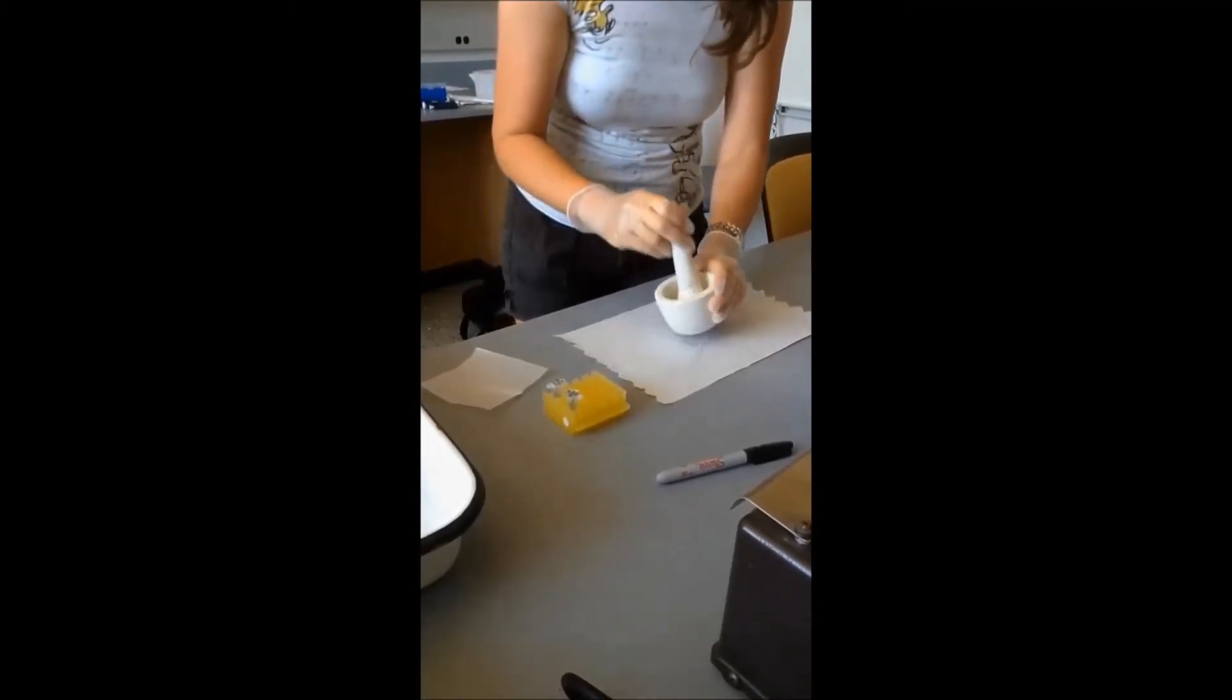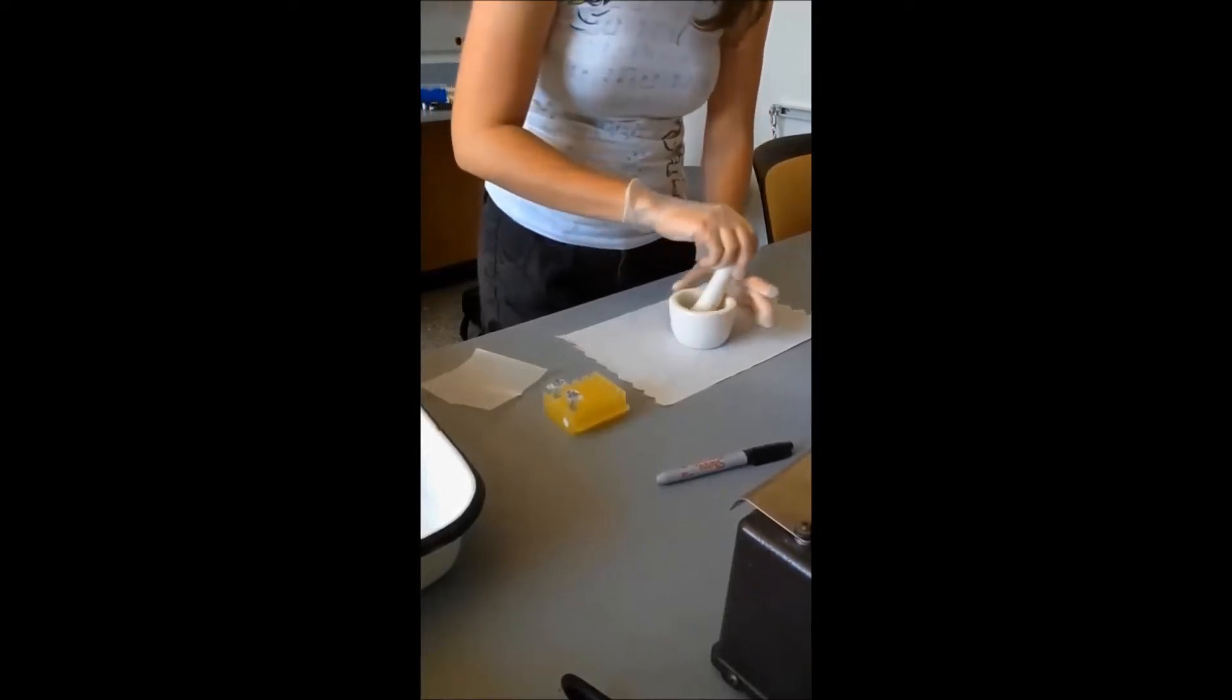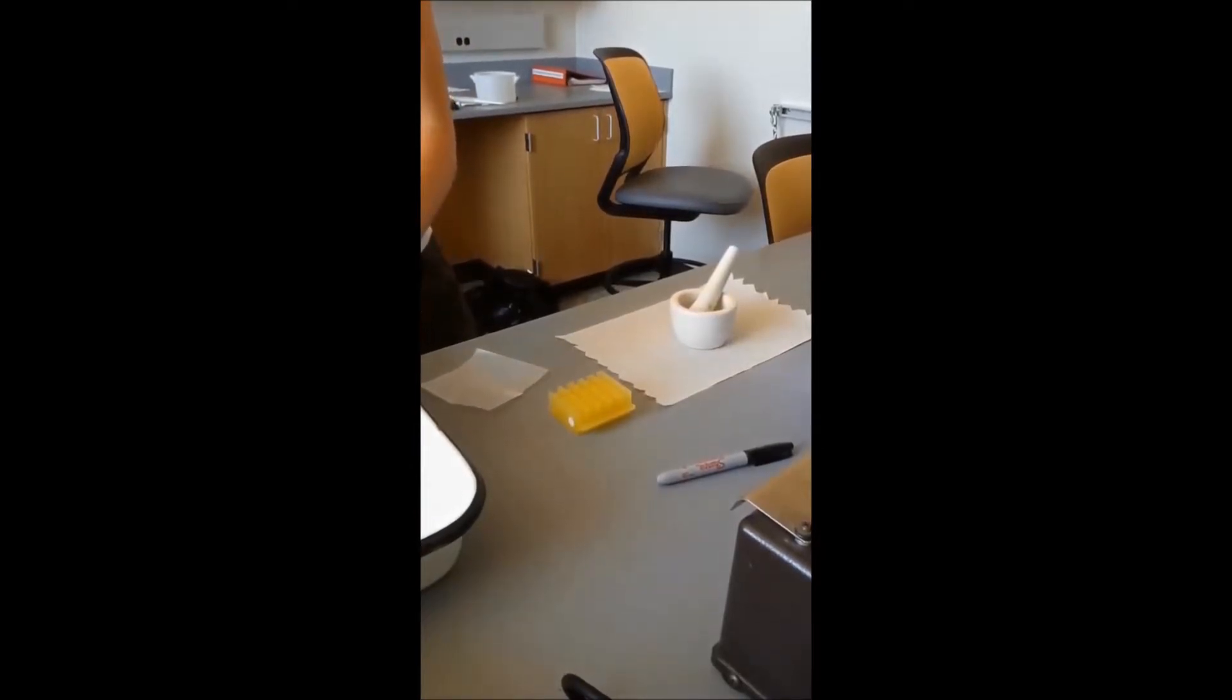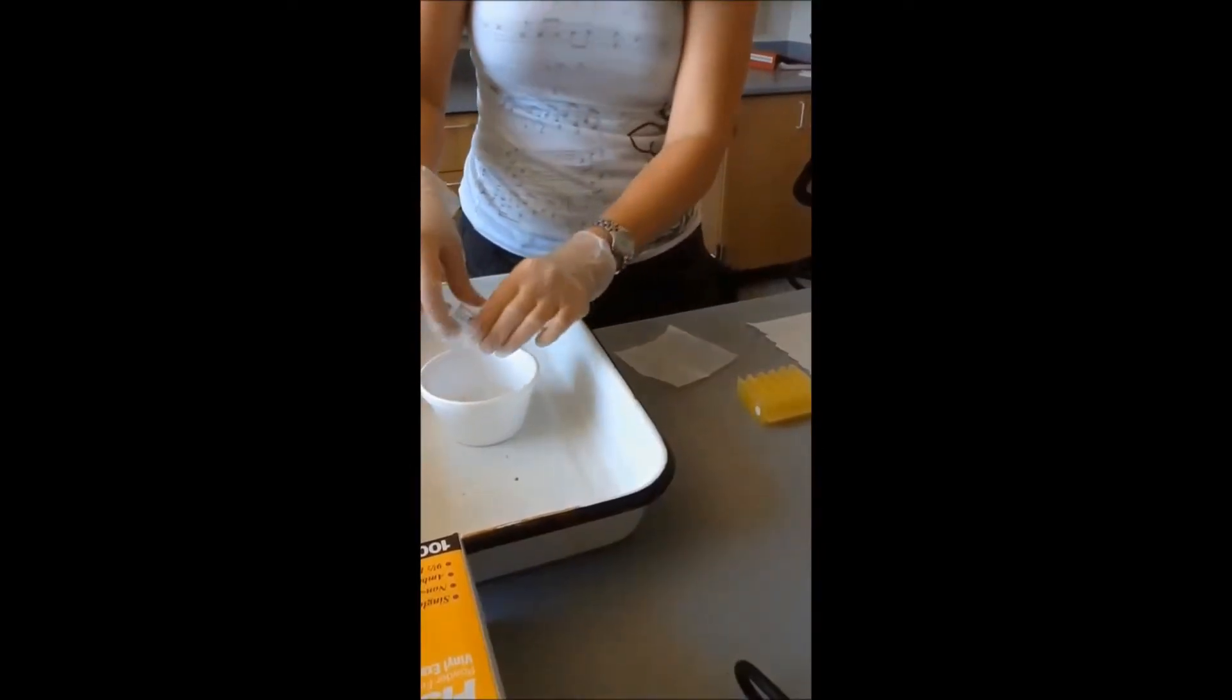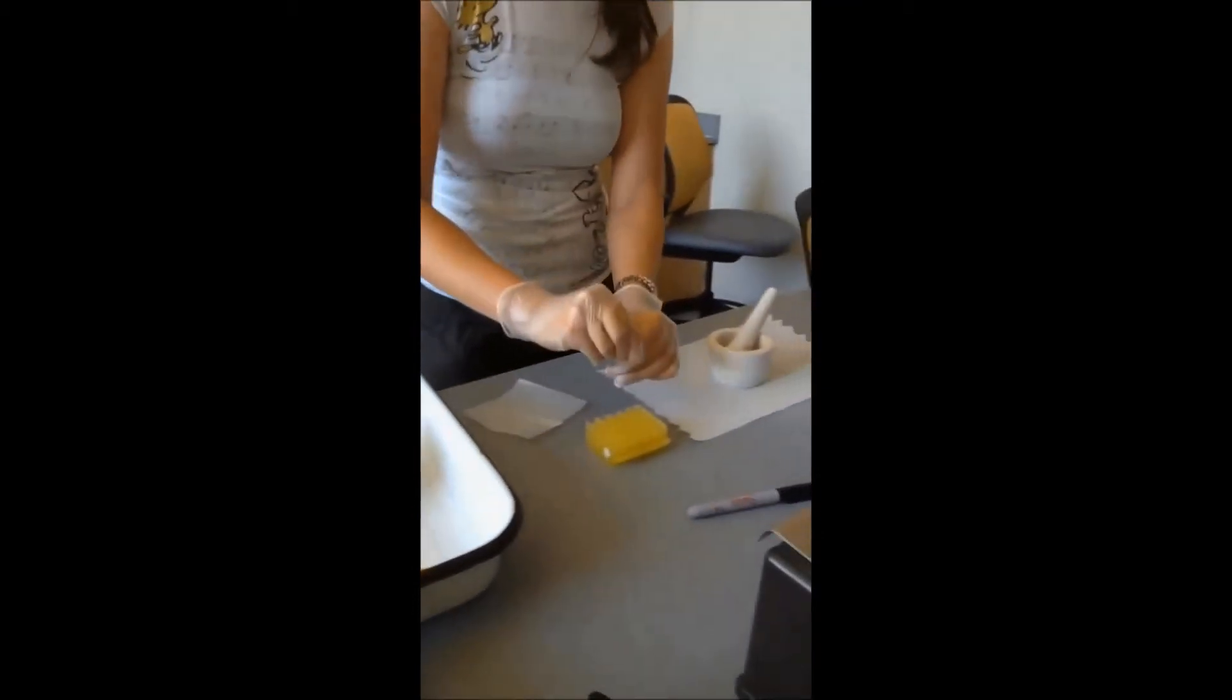That's looking like an extra nice fine powder. So what we're going to do is we're going to have our tubes pre-chilled in ice water. And then I'm just going to take the tube and we can use our little tube rack.